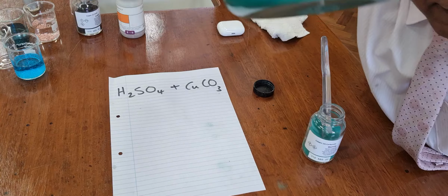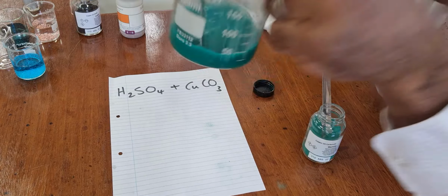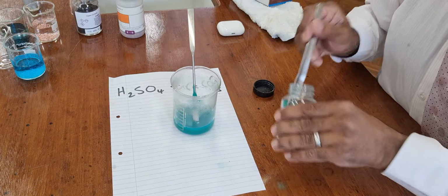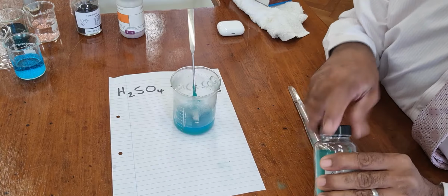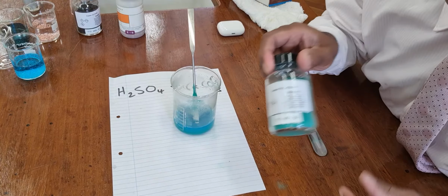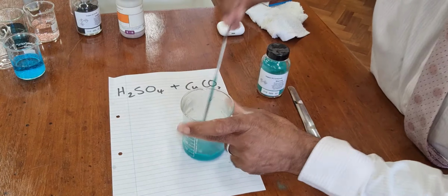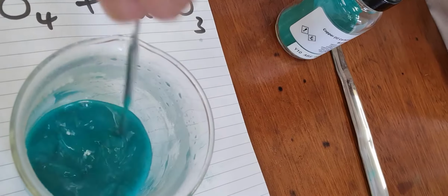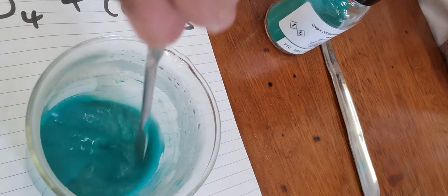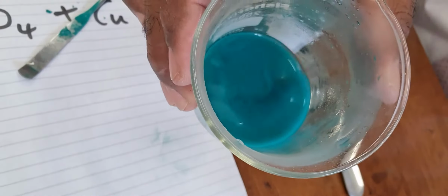And if you look at the beaker, can you see at the very bottom, there's some green solid left. If you're not sure, then you know what? Put some more in. It doesn't matter because the copper carbonate does not dissolve in water. The extra copper carbonate, we want it to be at the bottom. Let me show you. I hope you can see that. Green copper carbonate is extra because we can see it there at the bottom.